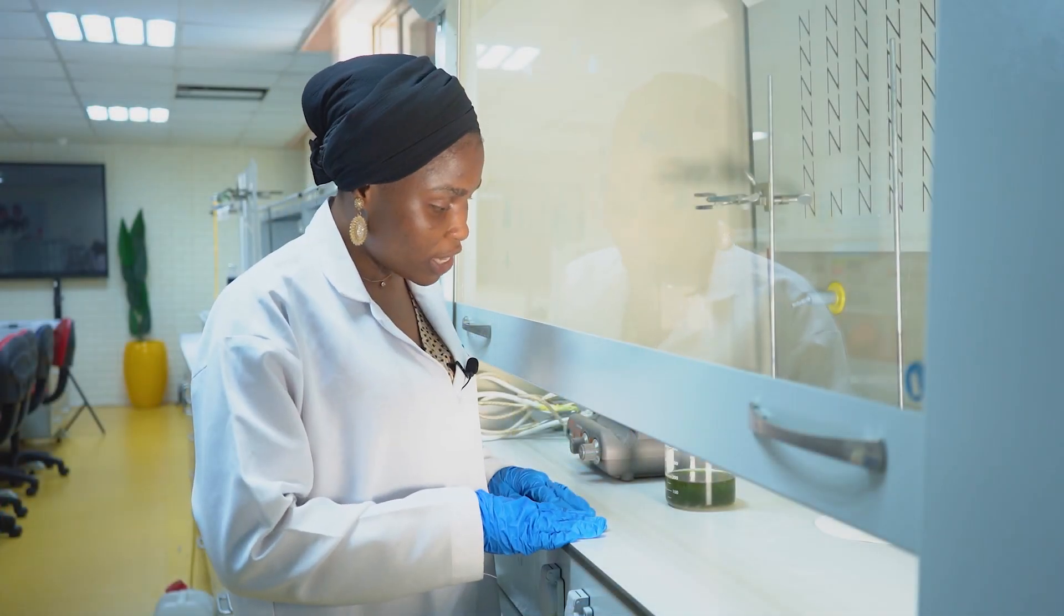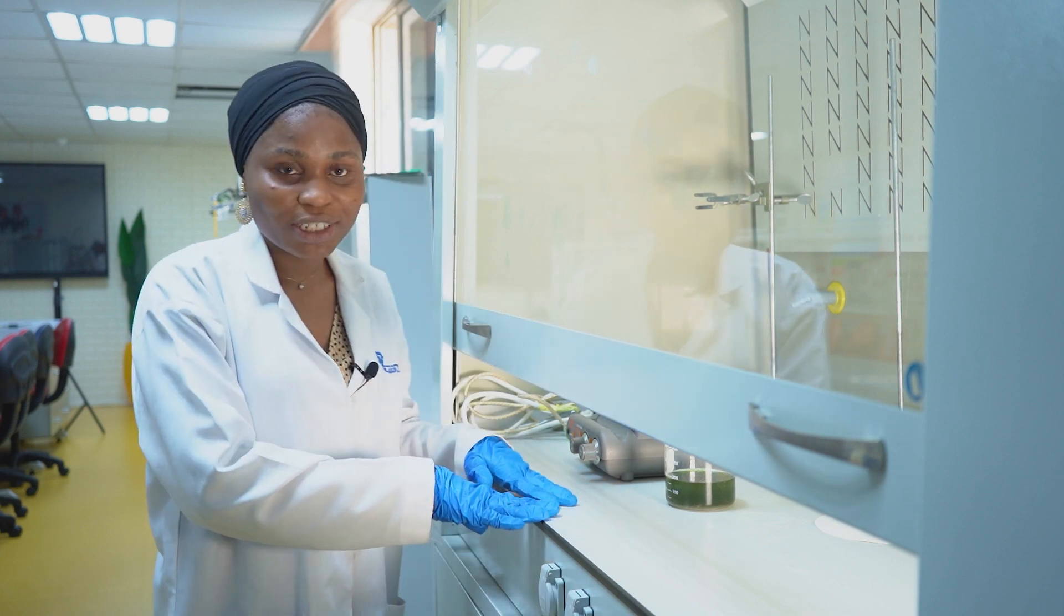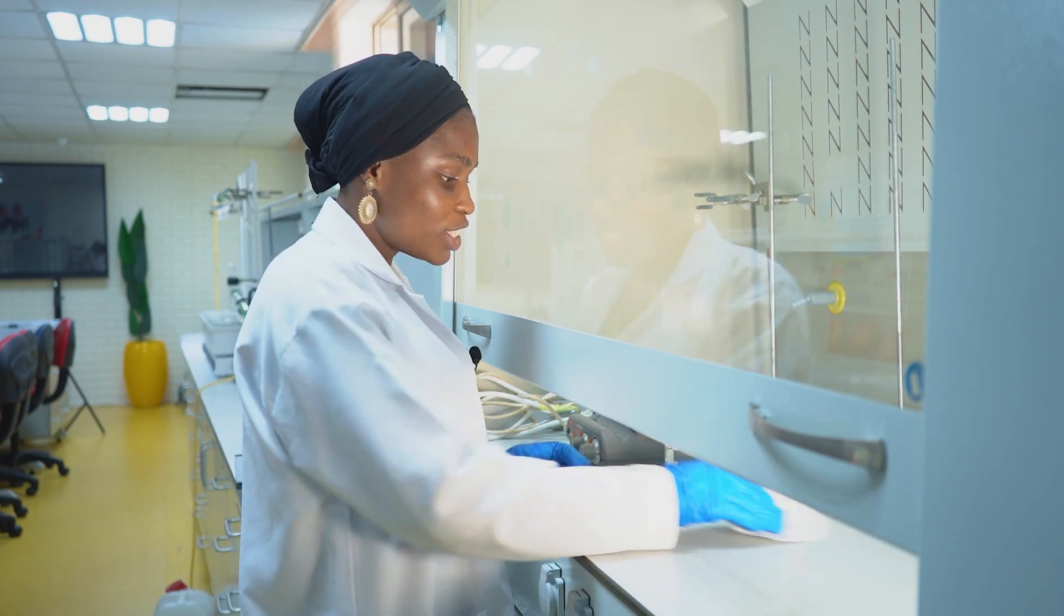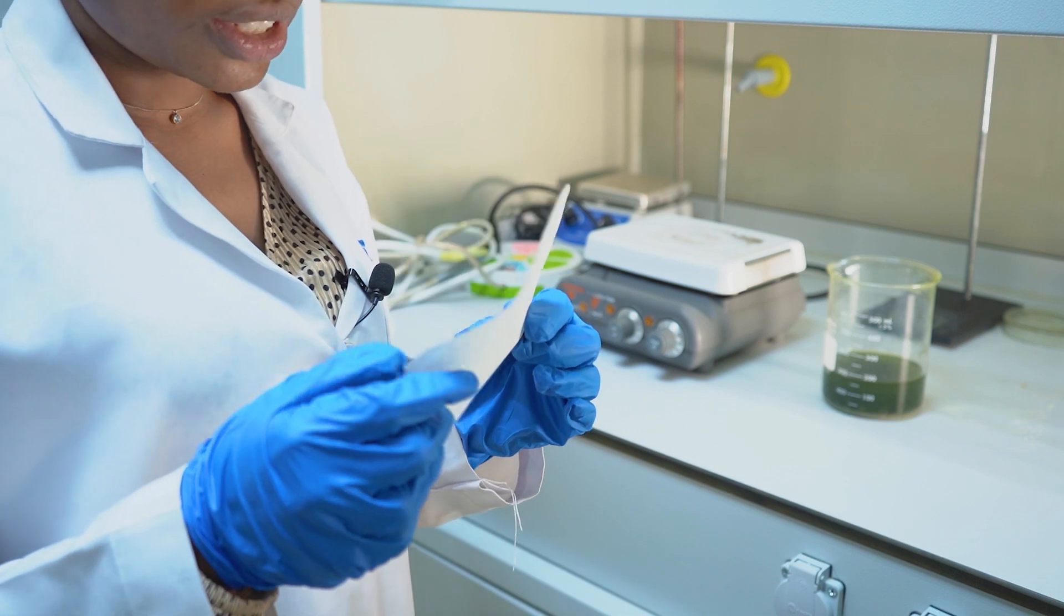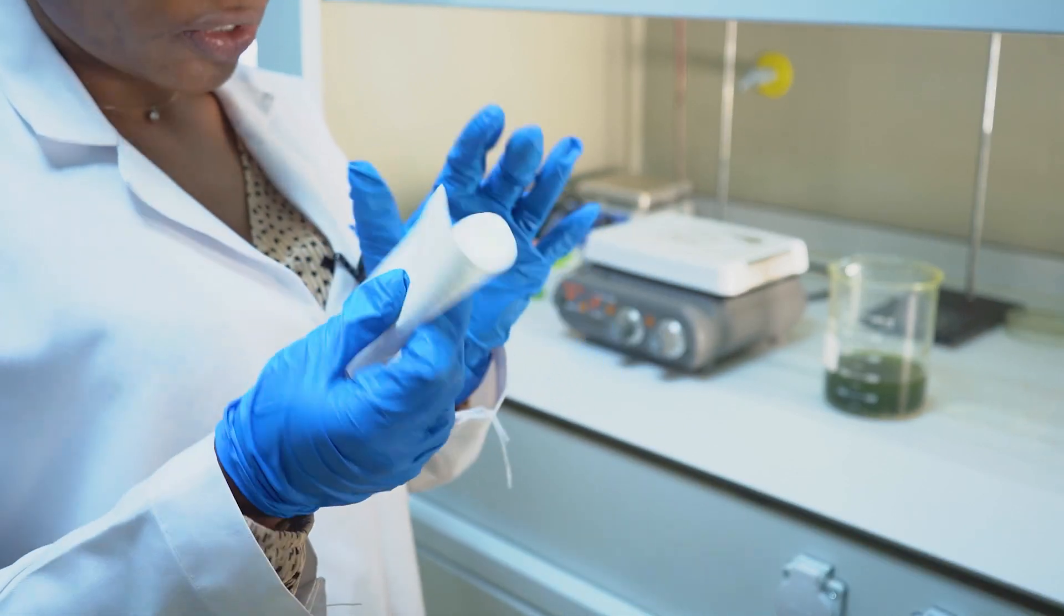When no bubbles were observed, remove from heat and allow to cool. Then the next process will be the filtration process. Now we'll be using our filter paper. This is the filter paper.